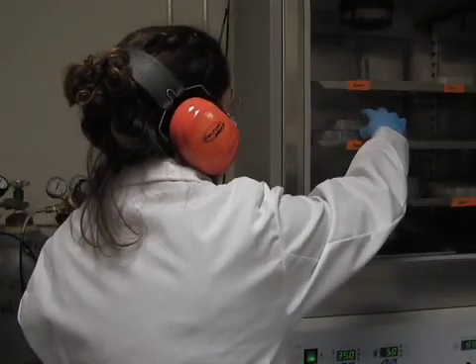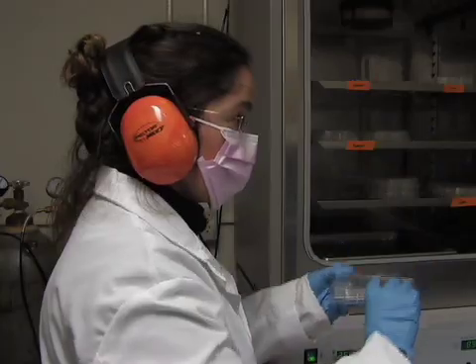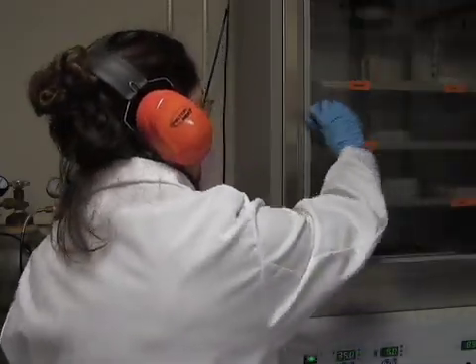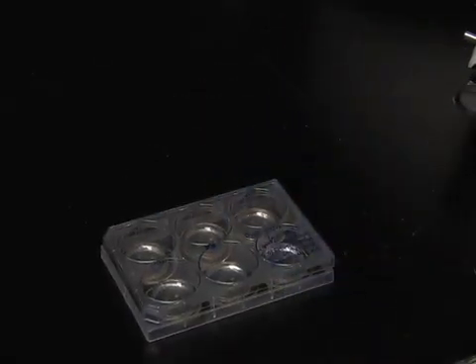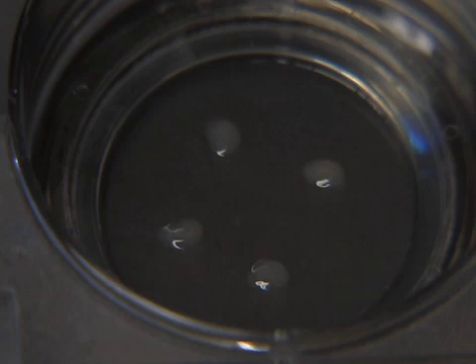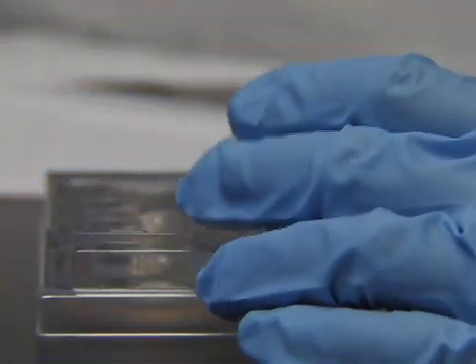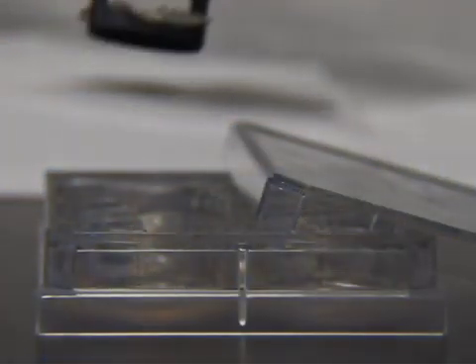After shooting the blank, remove the slices from the incubator. During our hippocampal dissections, we place four slices per well and arrange them so that they form the corners of a two centimeter square near the center of the membrane. Shoot each well with the diffuser screen about one half to one inch from the slice.